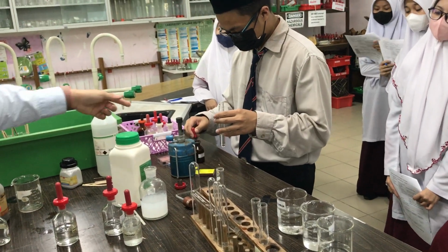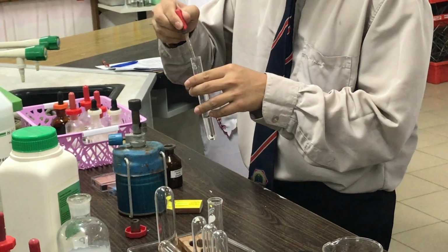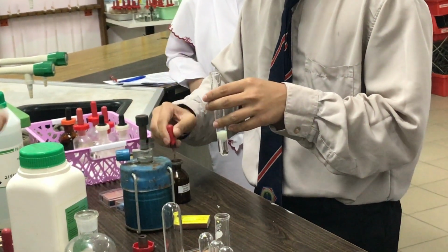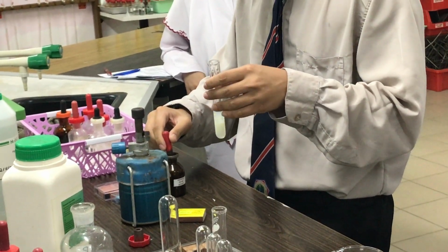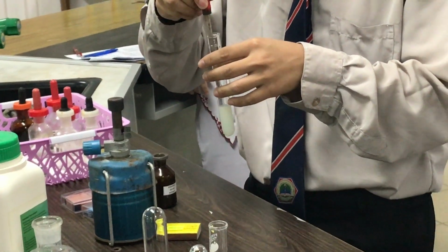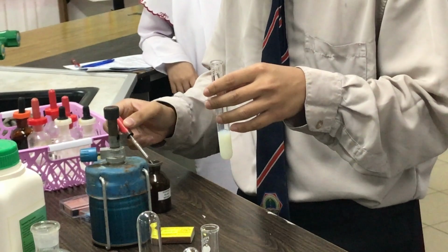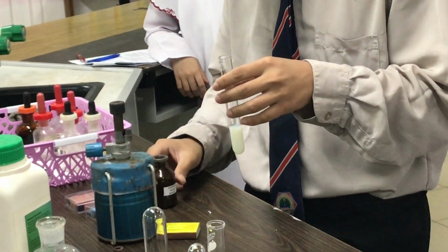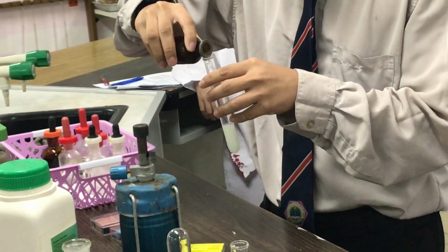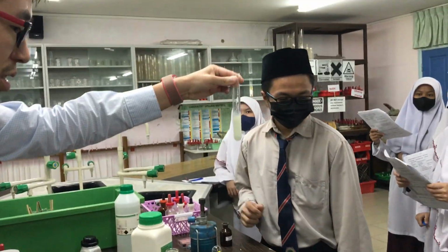So silver nitrate is the solution, okay? So see what Saiful got, okay? Yeah, keep on adding. Shake it. Keep on adding more. Okay, add some more. So again, just pour. Just pour from the bottom. Okay, alright, thank you. Alright, this is more yellowy.